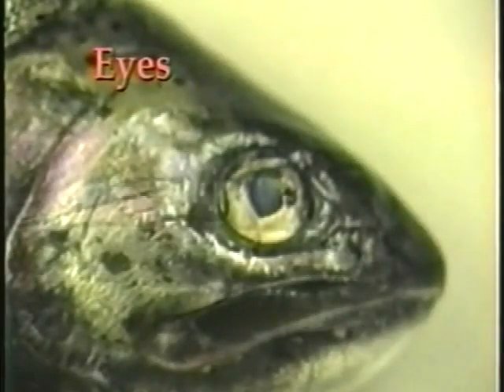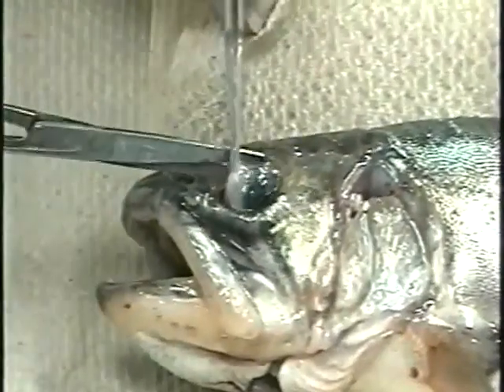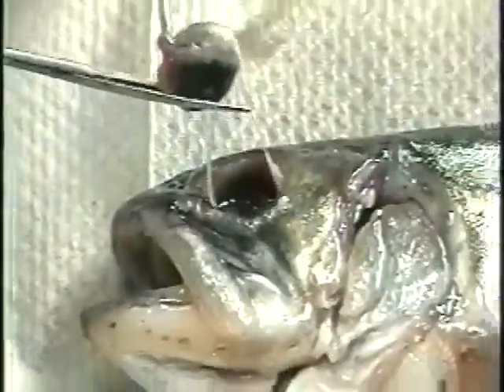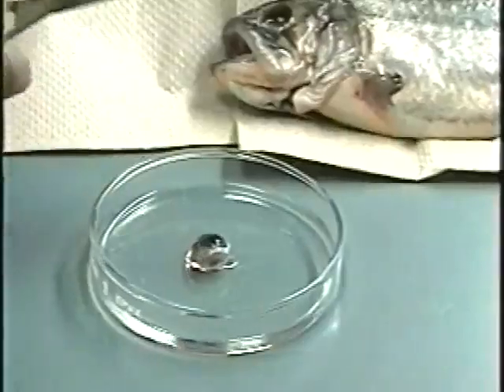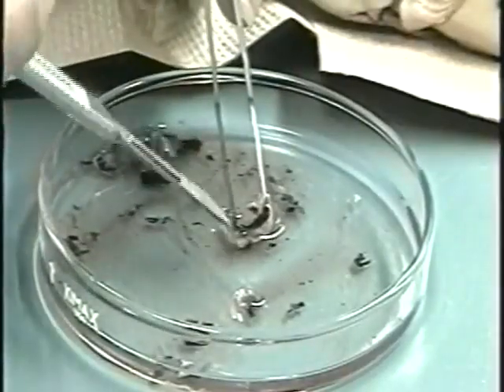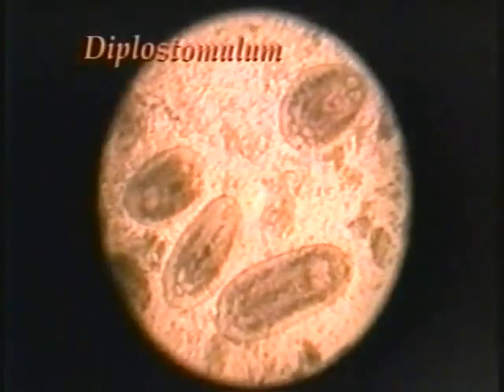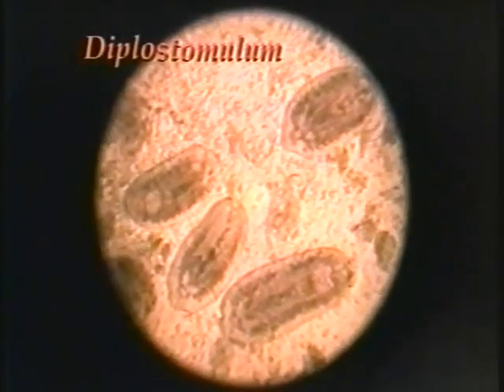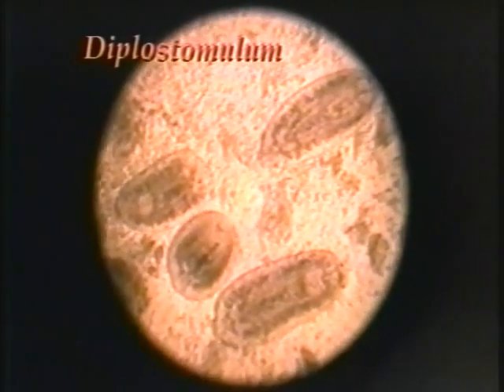Eyes should be grossly examined for abnormalities. For closer examination, gently remove the eye using forceps and scissors, placing it in saline in a petri dish, and examine using a dissecting microscope. The eye can be dissected and the lens, humor, and retina examined using the dissecting or the compound microscope. Certain species of parasitic worms, including the eye fluke, may be found in the eye, and infections may result in blindness.